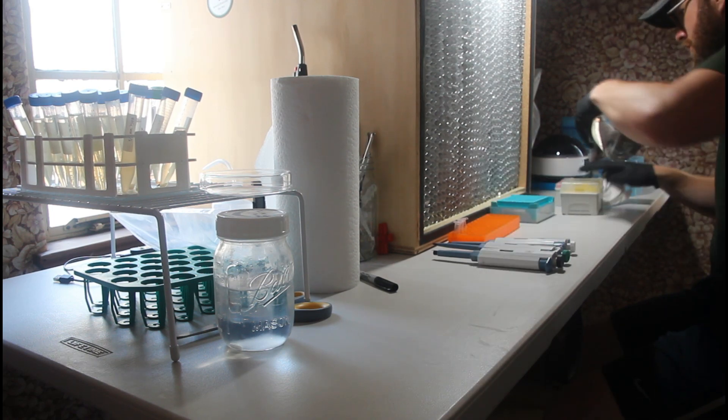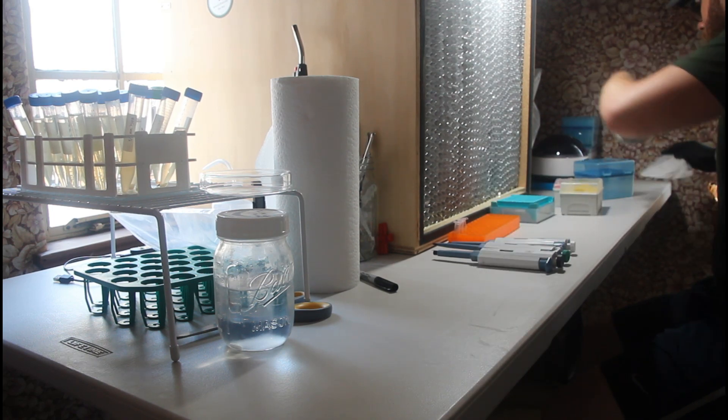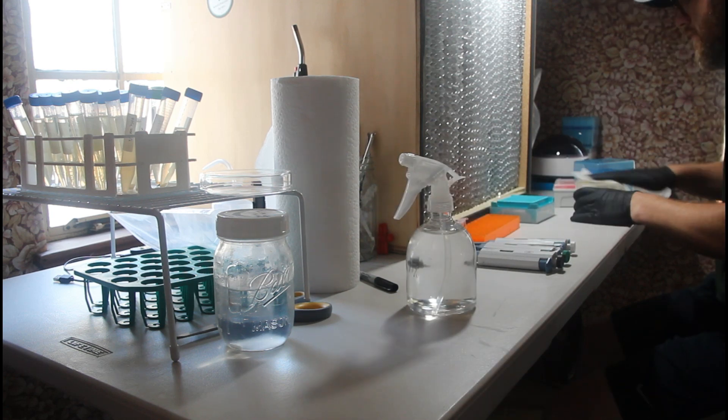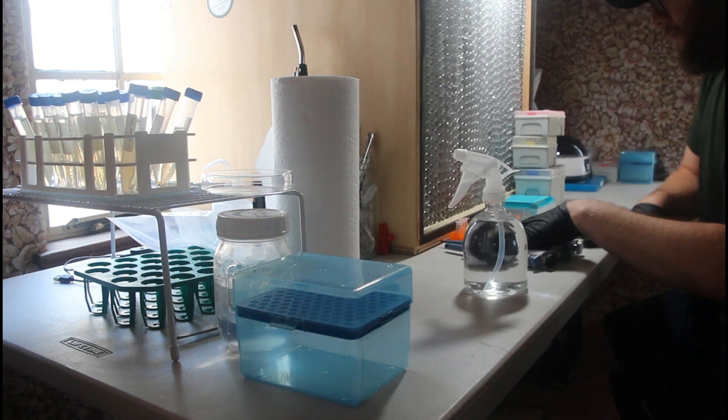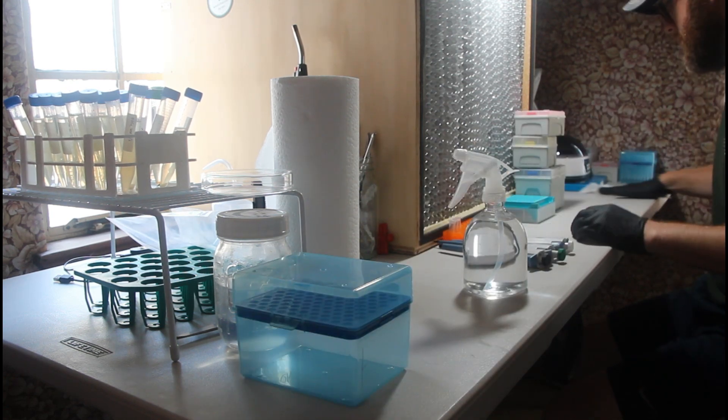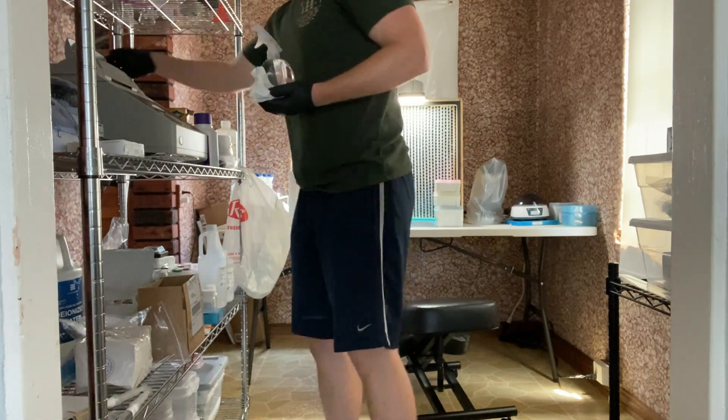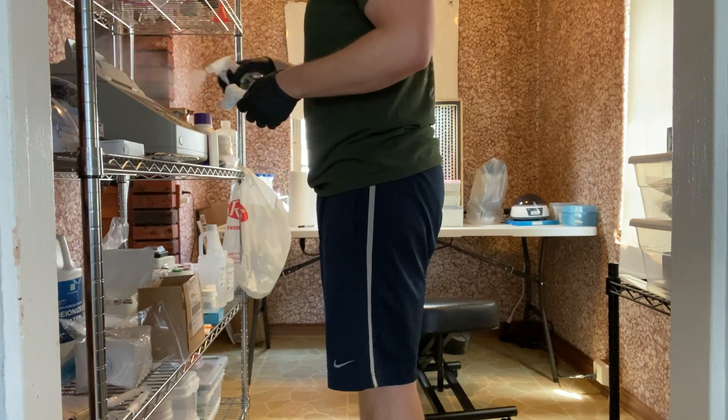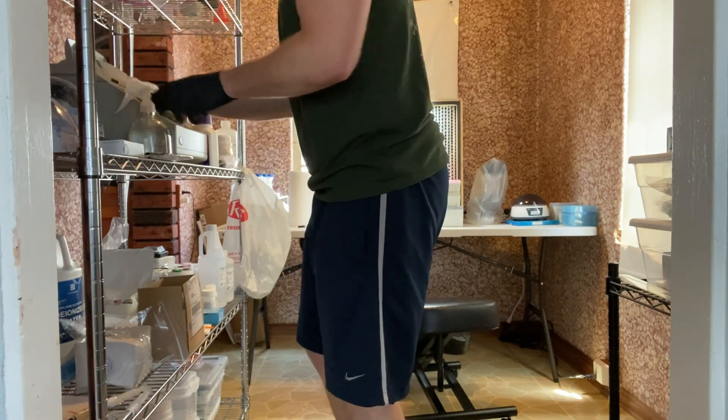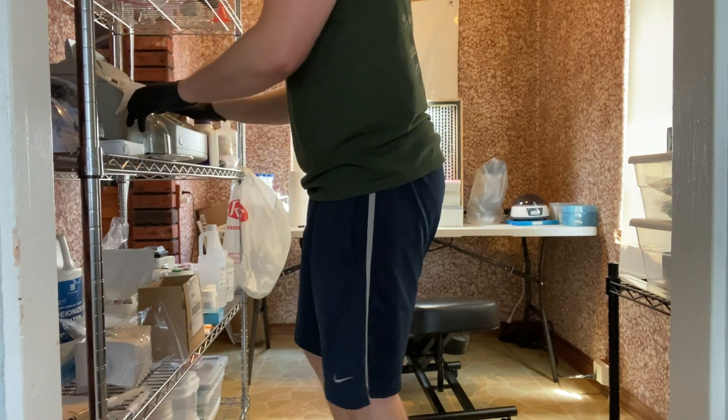In addition to wiping down the tube holders that will be in very close proximity to the samples we'll be preparing today, I also like to wipe down my thermocycler as well, since I'll be transferring the tubes to the thermocycler and to the centrifuge just right next to it.